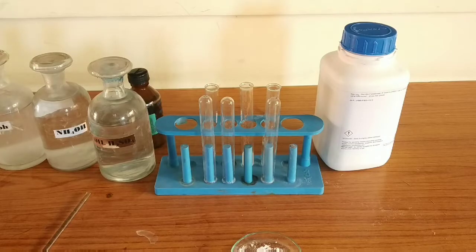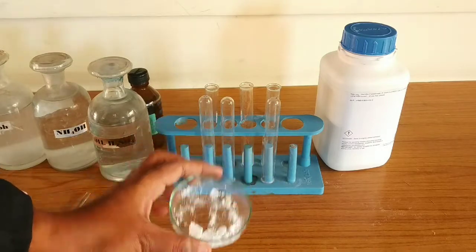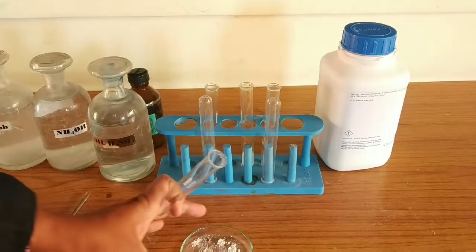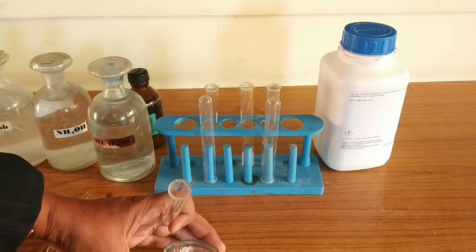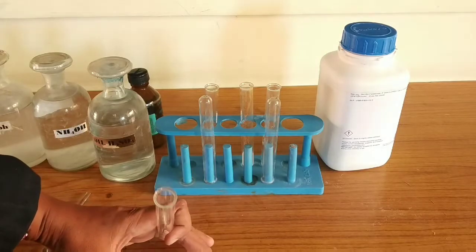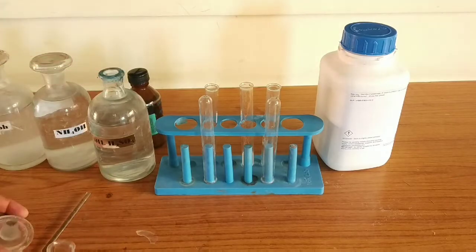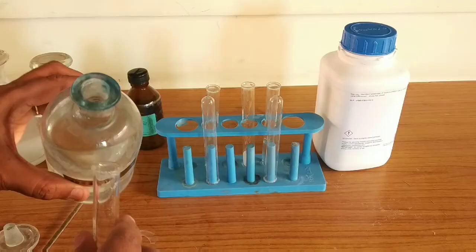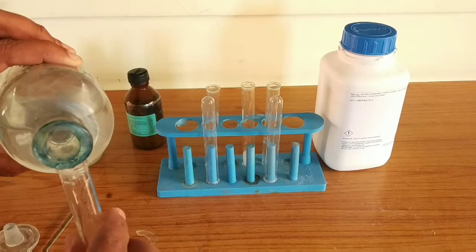From the same salt, we will now detect the acidic radical. We already know the basic radical is ammonium. To identify the acidic radical, take another very small quantity of salt and pour dilute H2SO4 into it.